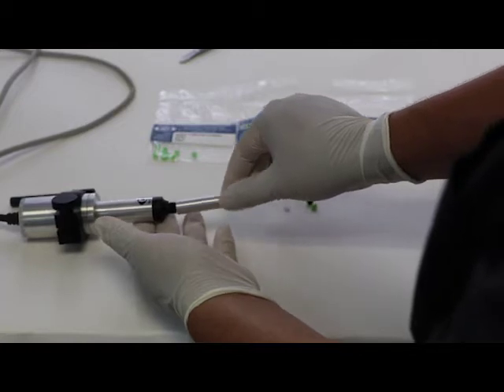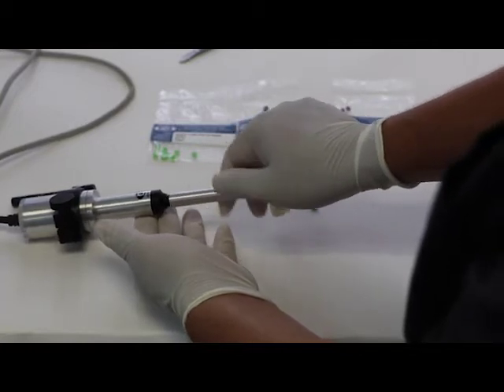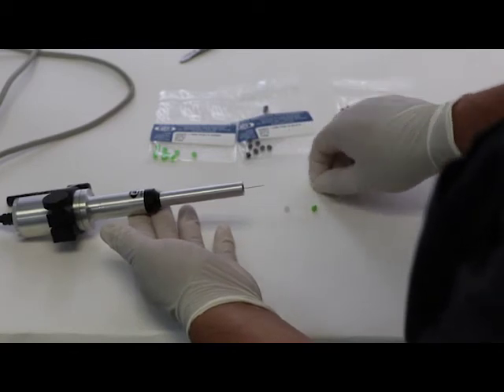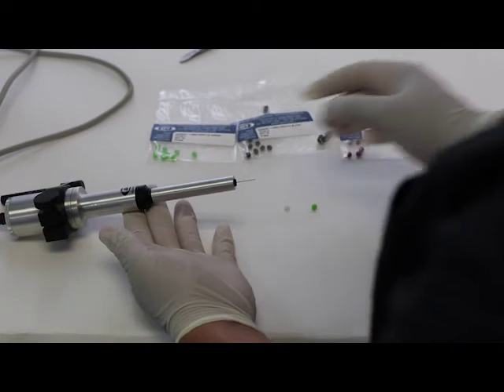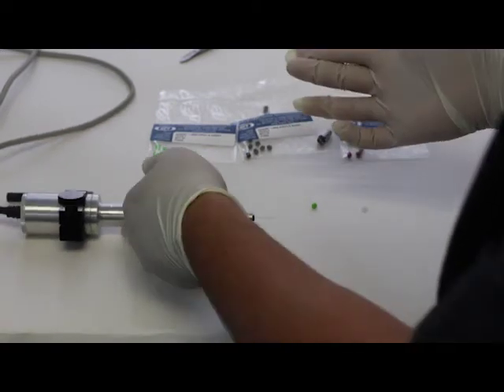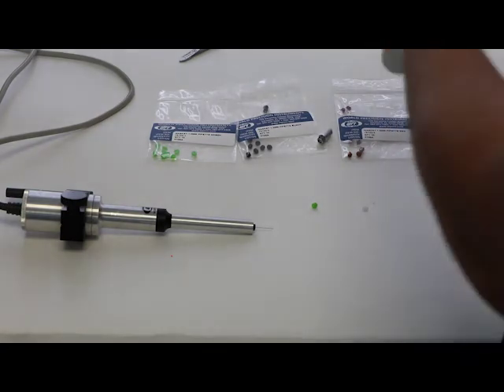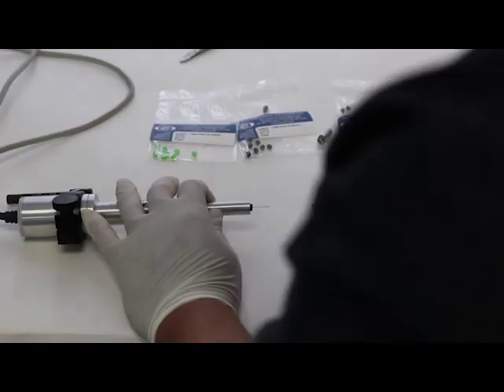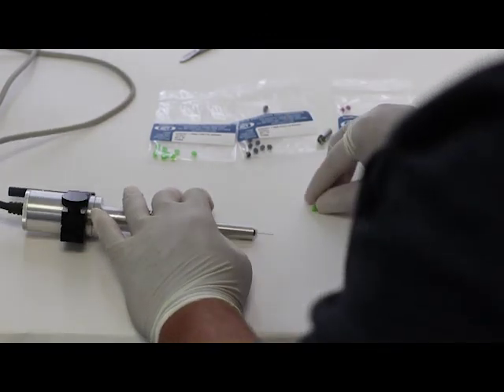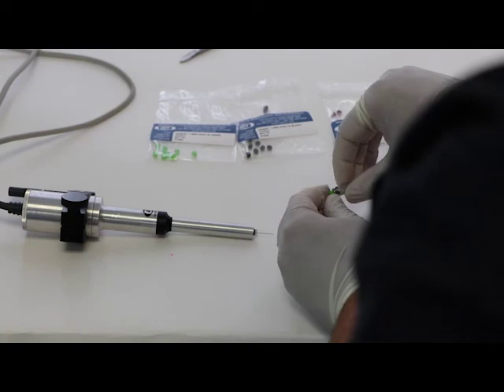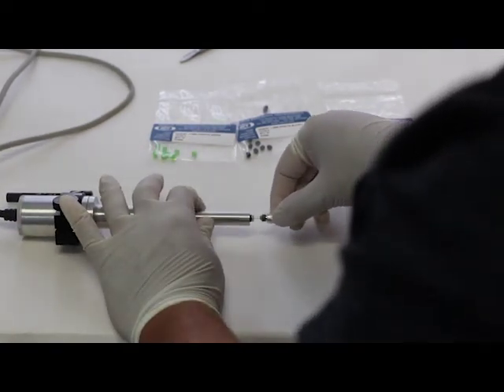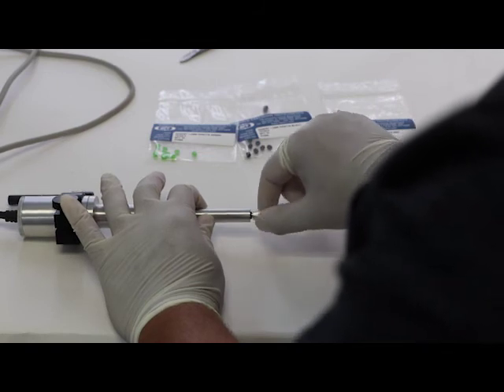So we put in the body of the injector, screw it securely. The first gasket that we're going to add is the seal gasket. We have to make sure that it's on the right orientation. The second gasket is the spacer, and this is where the glass sits on the injector. And you have to also make sure that it's in the correct orientation. There's a concave part that goes towards the outside. And then the third gasket is capillary gasket, which you can put it on the collet, and you can drive it. And then you just got to make sure you screw it in secure.